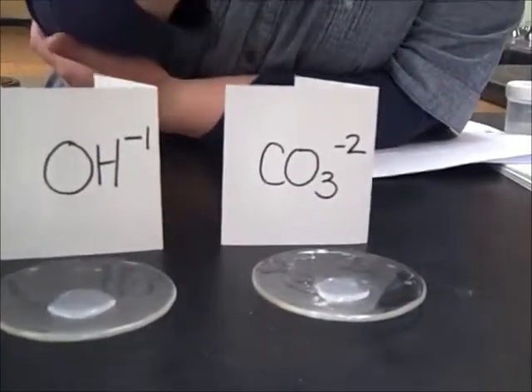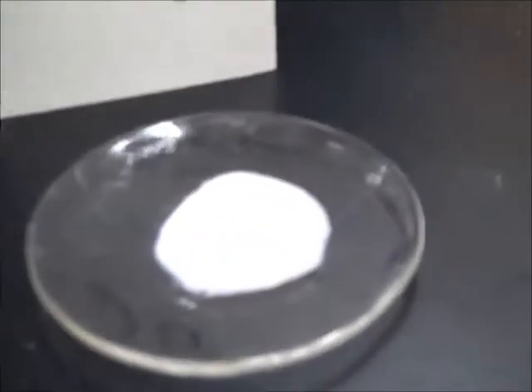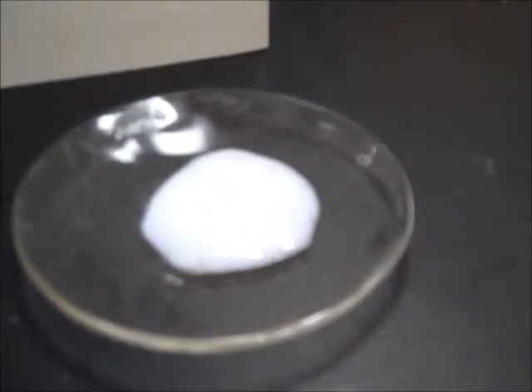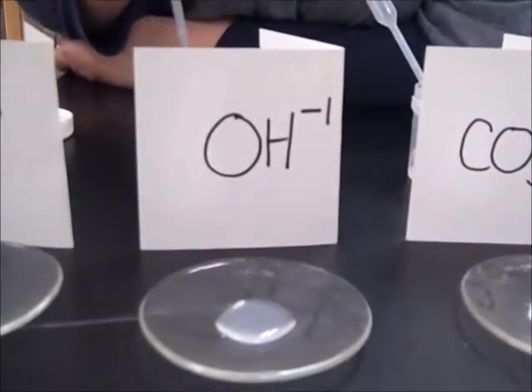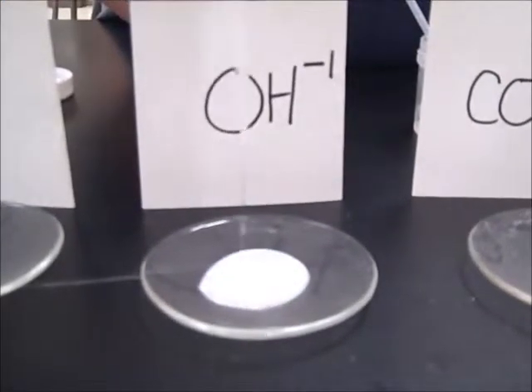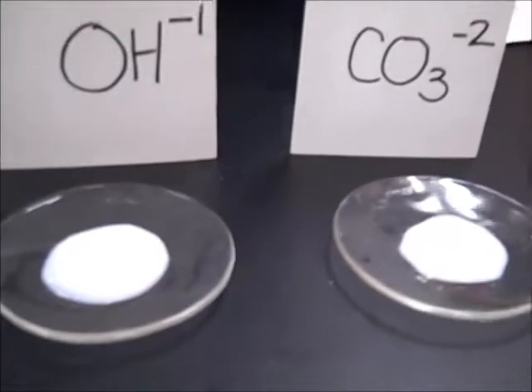Ask me. All right, here's the carbonate with the lead. Ooh, good. Yeah, you need to make those sound effects. See, cheap help nowadays gives you cheap sound effects. All right, next one is the lead and the OH minus. Ooh, yep, making more milk here.